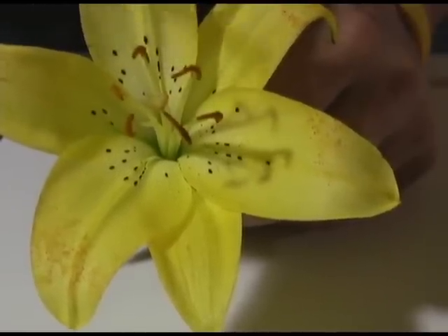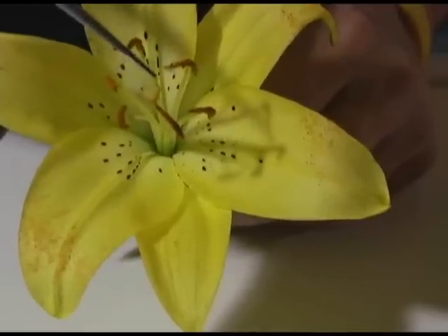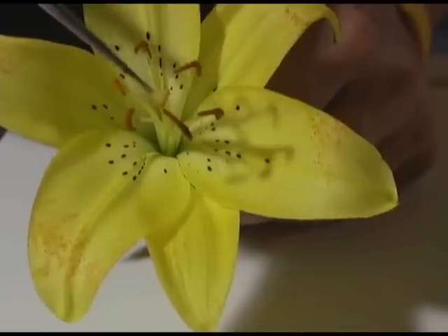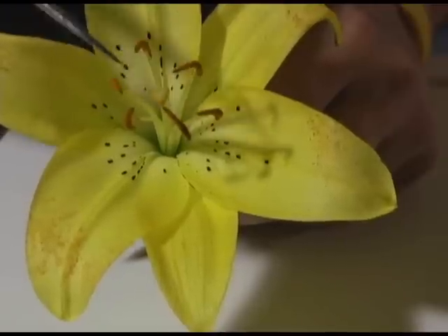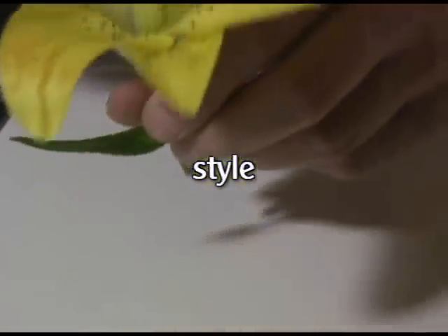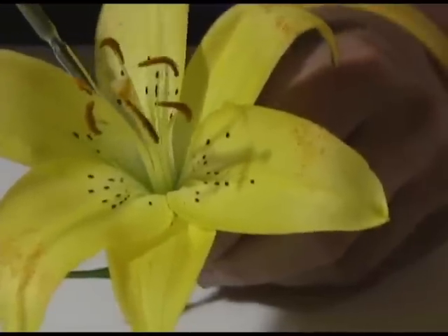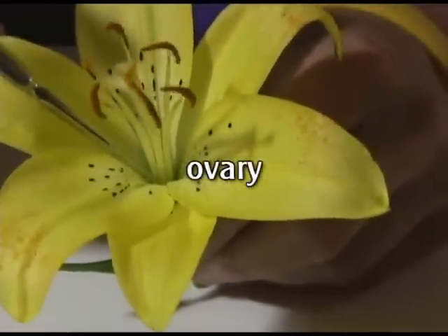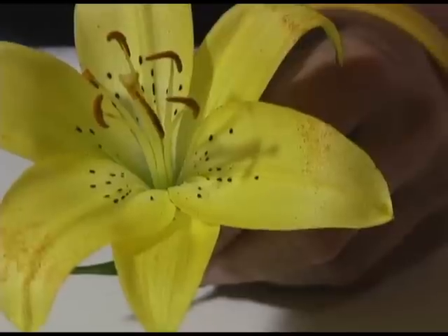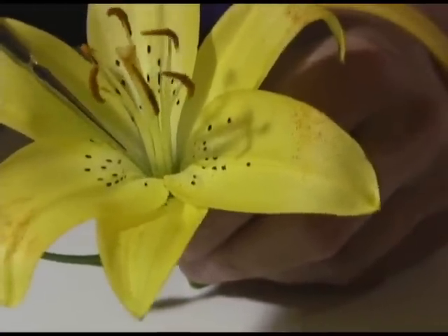The pollen, which is the male sex cell, then grows a tube down this central stem-like structure called the style. So we've got the stigma, the style, and deep down inside the plant — it's going to be very hard to see until we actually open this thing up — is a structure called an ovary. You've heard of ovaries before with respect to human reproduction — the human ovary produces eggs. Same thing for an ovary in a flower: they produce eggs as well.